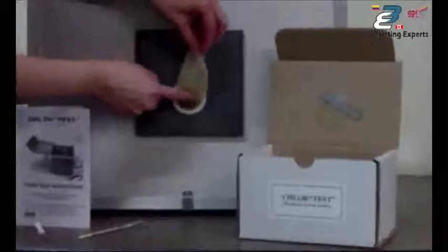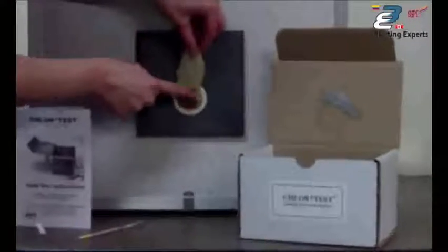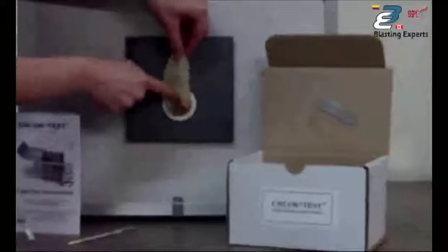Lift the sleeve from the bottom so the extract runs against the steel surface. You massage that with your fingertip and you massage it for two minutes. We suggest you use a watch with a second hand. Two minutes is actually longer than you think it is. You can actually get pretty rough with massaging it. That latex is pretty thick. It's very tough. You're not going to poke a hole through it or tear it.